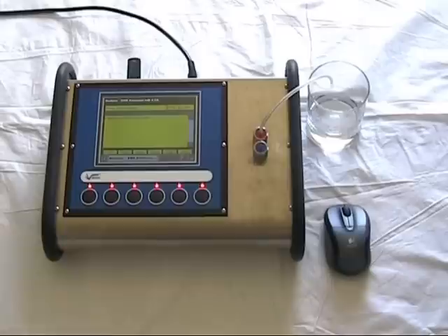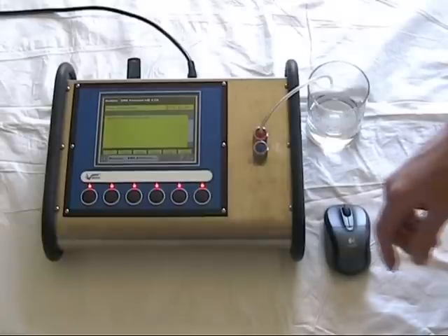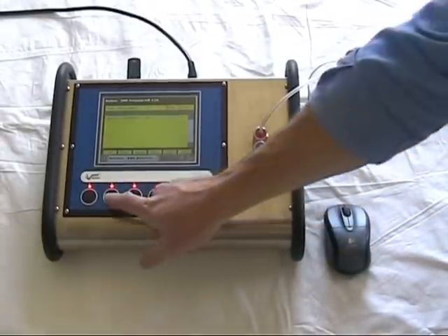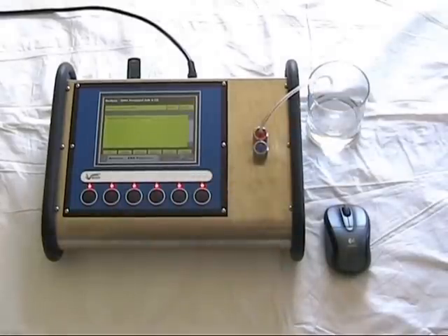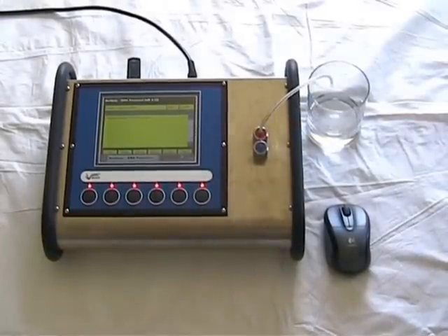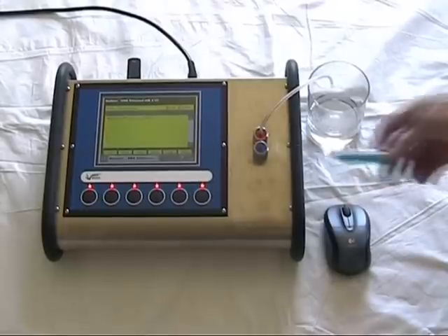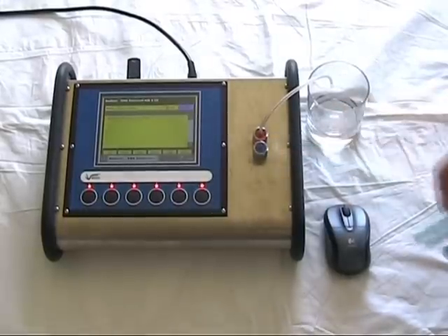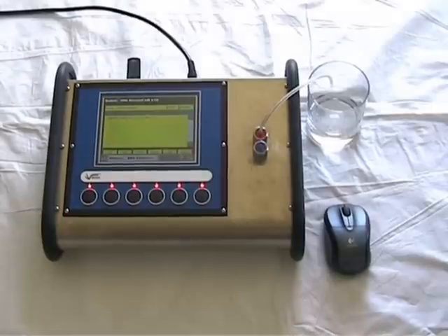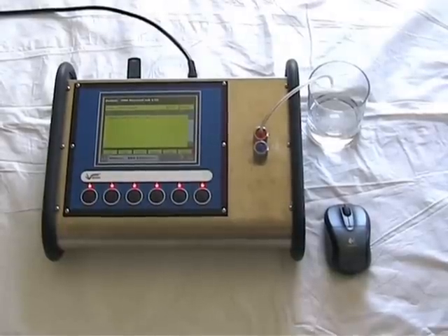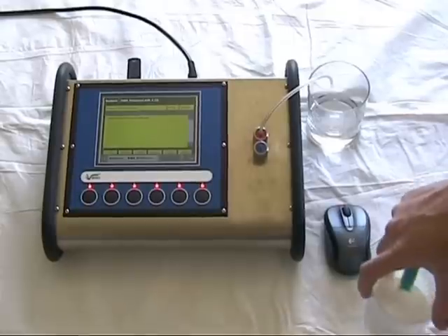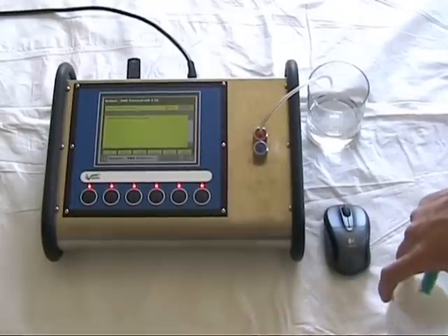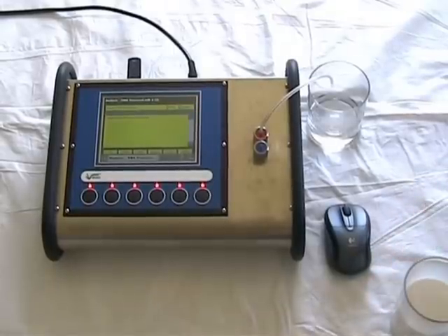To make a measurement, the user presses the start key and the measurement takes about 60 seconds. The cuvette where the measurement is made is held at 40 degrees. So the sample temperature, the temperature of the milk to be injected, needs to be close to 40 degrees.